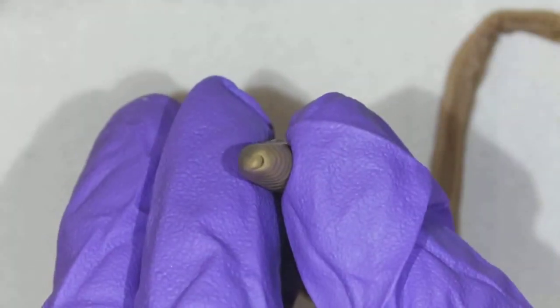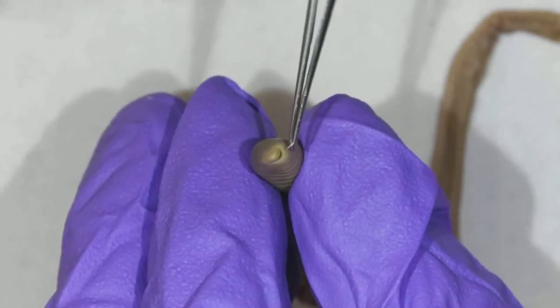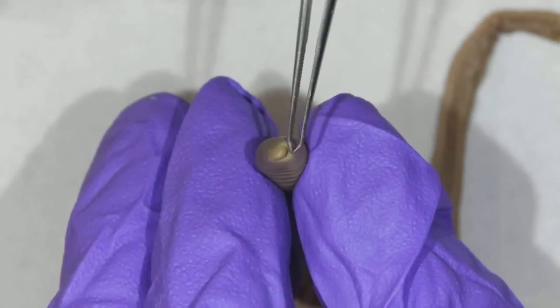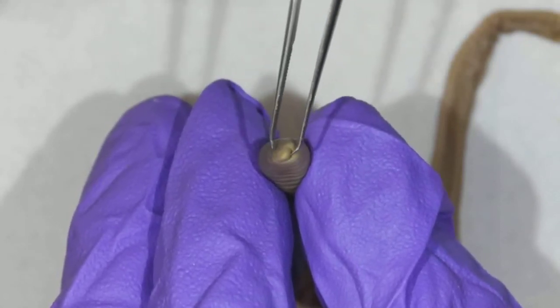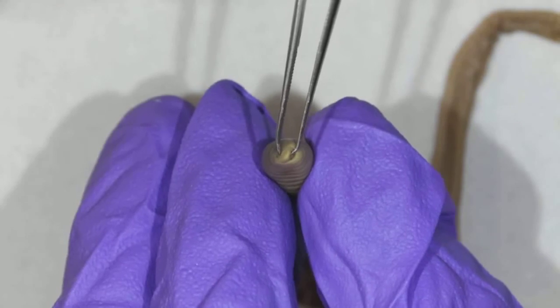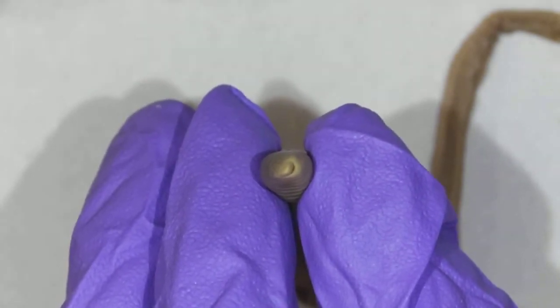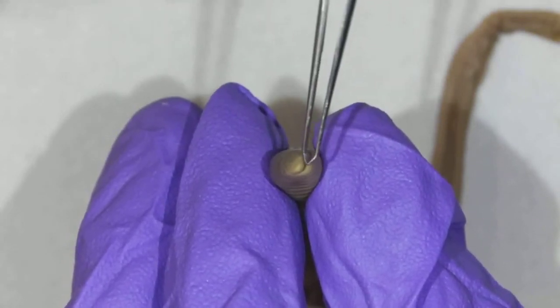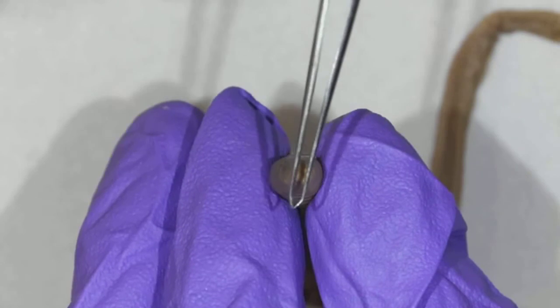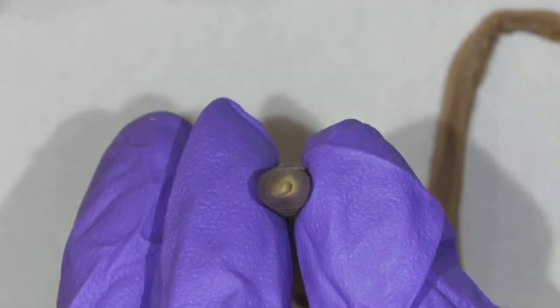focus again. Oh, look, it's like he's smiling at you. Oh, see that little smile? That is actually his mouth. So that opening is the mouth. And this little part right here, it looks like the lip, right? That is called the prostomium. Prostomium. And the mouth is the opening, and that is found on the anterior end of the worm.